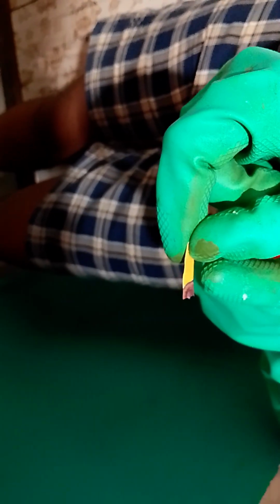Let me show you in the air. We are getting a rainbow. While I'm like, why have I got a rainbow here? This side red, in the middle part red, then it goes no green but directly blue. I can understand why I've got a rainbow. Yeah, it has turned red now. Okay, we need to wait for it to fade to total whiteness.